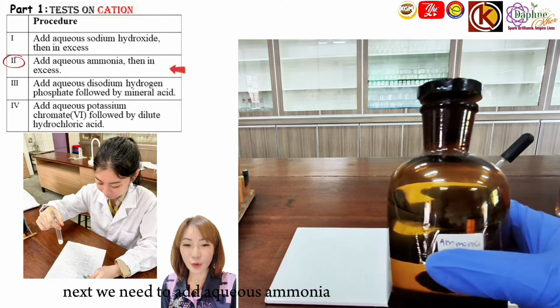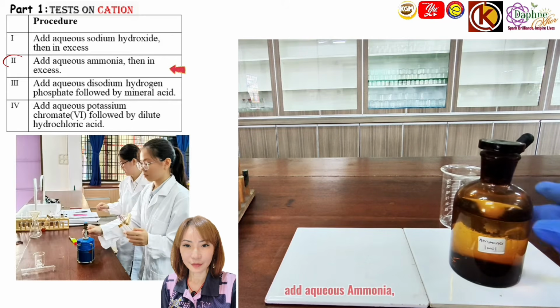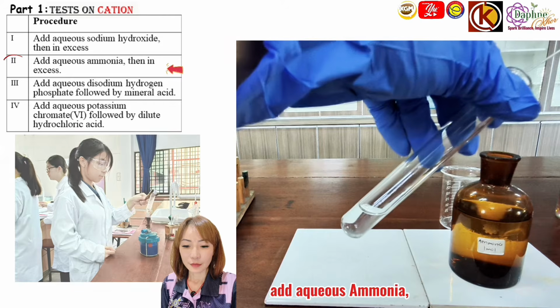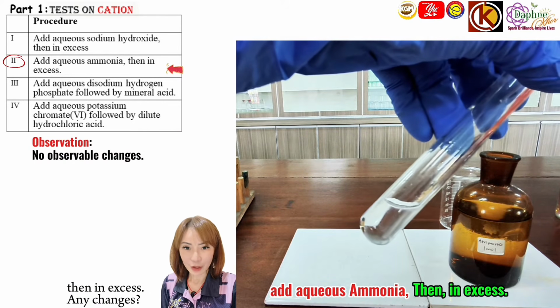Next, we need to add aqueous ammonia. Any observable changes? Then in excess, any changes?